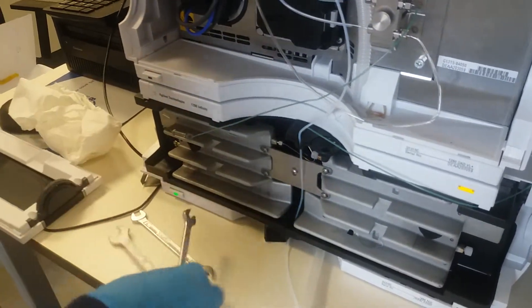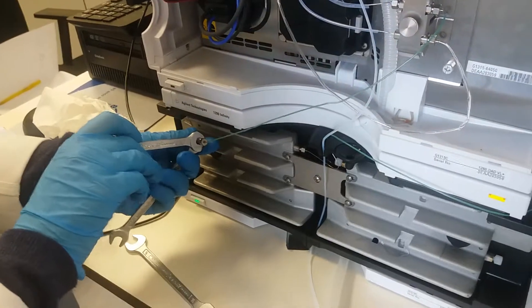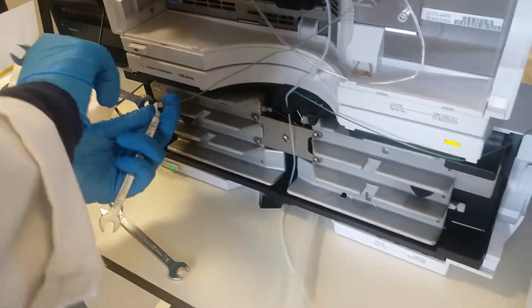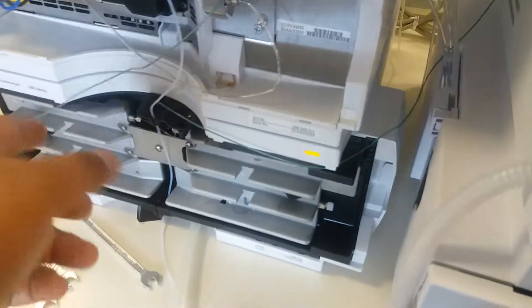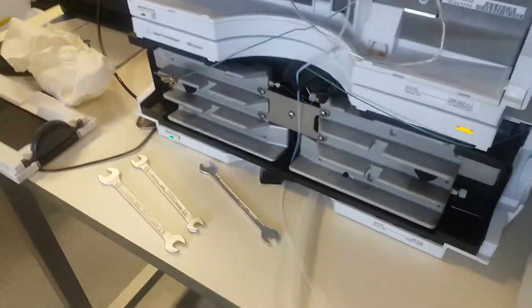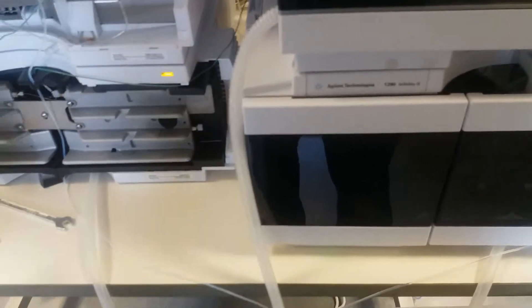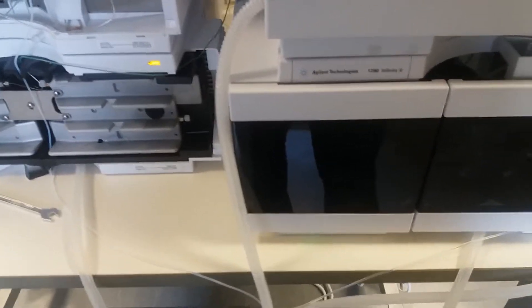I will share the conditions. If you have some doubts, you're welcome. When you put it directly with this, it's because first we purged the system — we did the purging, prepared the pump. After that you start your method without column, and then you can put the column.